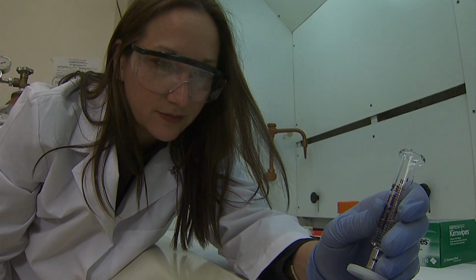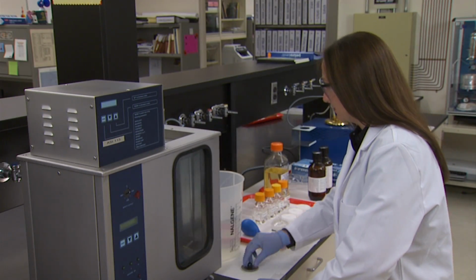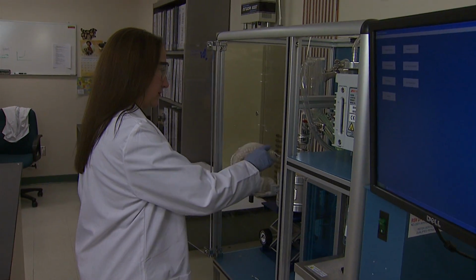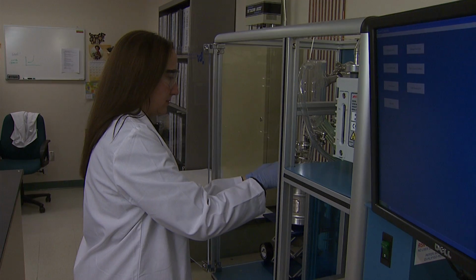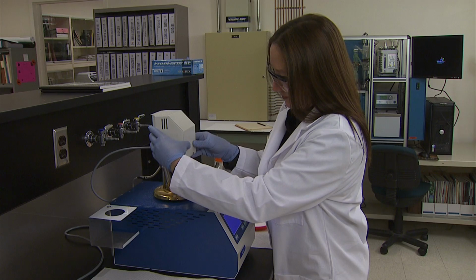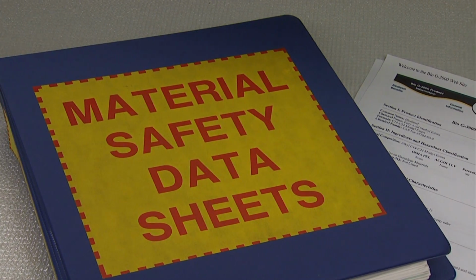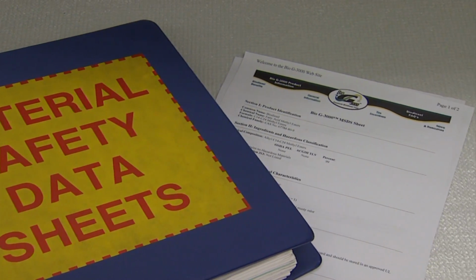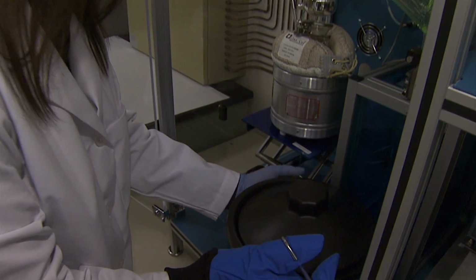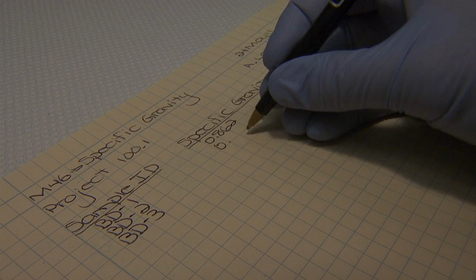The good laboratory practices associated with safety and personal protective equipment represented in this video are simply the safety requirements of the FAPC Analytical Services. We urge you to determine what specific good laboratory practices and particular safety requirements are necessary for your own method application. Some of the recommended guidelines include: follow safety precautions at all times. Consult the material safety data sheet for detailed information on the chemical substances related to the method. Wear the appropriate personal protective equipment for handling chemicals and instrumentation. Record data at the time of observation.